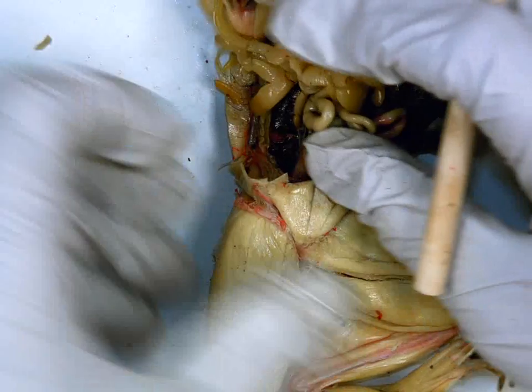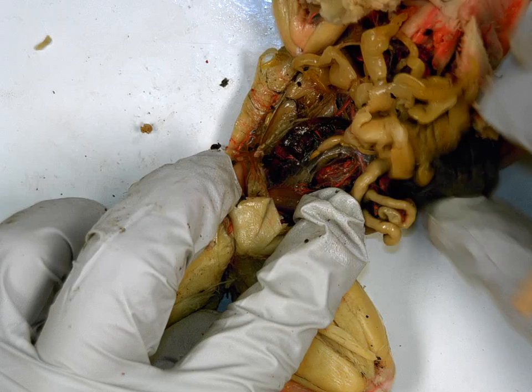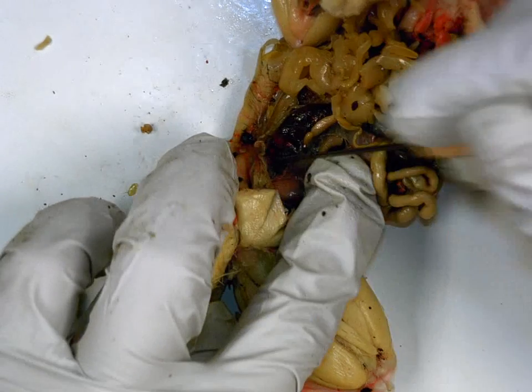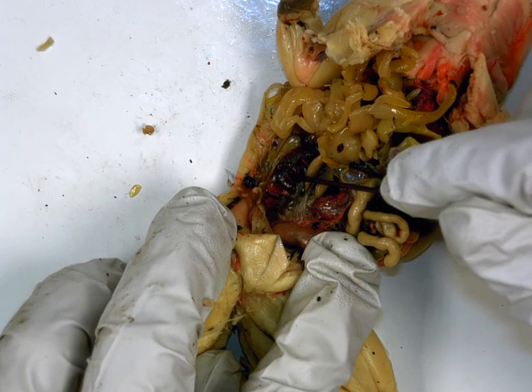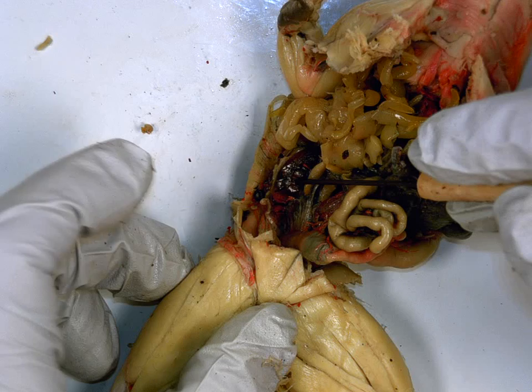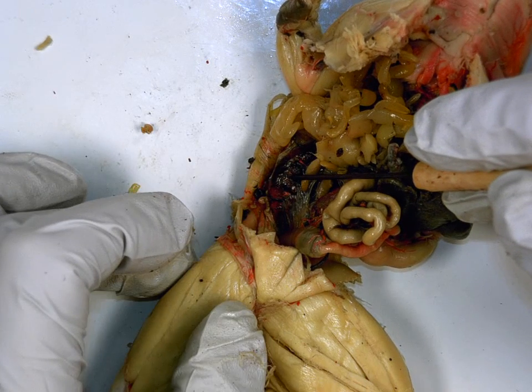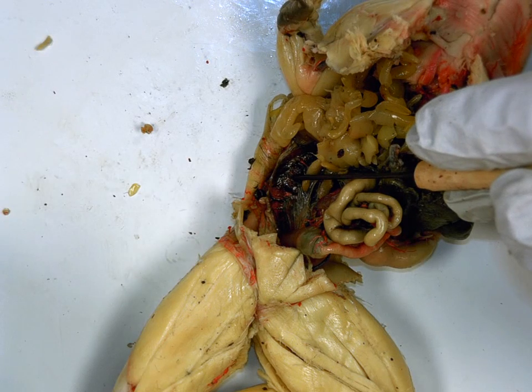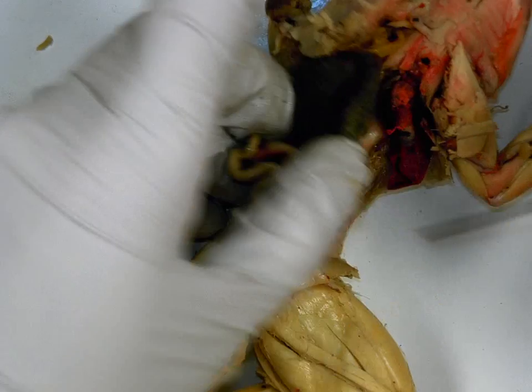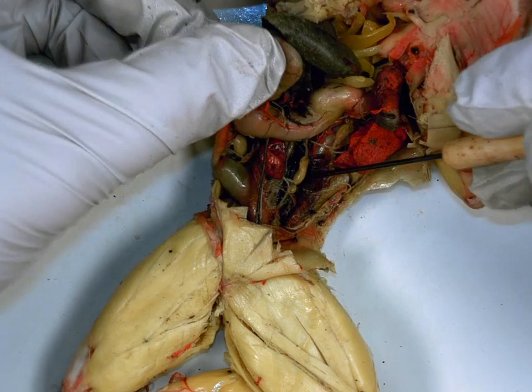Now, for the reproductive tract, it depends on which frog you have, whether it's male or female. This is a male. And if it's a male, you're going to have to look way in the back, and sealed onto the back wall are these dark structures. What are these dark ones sealed into the back wall? Kidneys. 3 functions of the kidneys. Remove salt, remove excess water, and filter metabolic waste. Now here would be the kidney on this side. You can see there's a kidney here, dark, and a kidney on the other side.